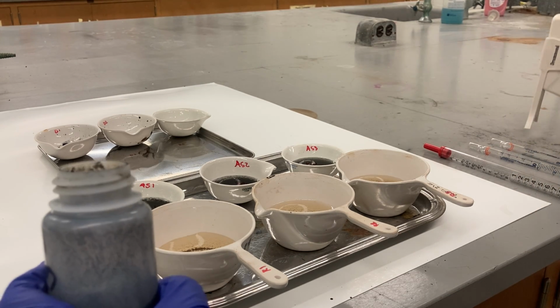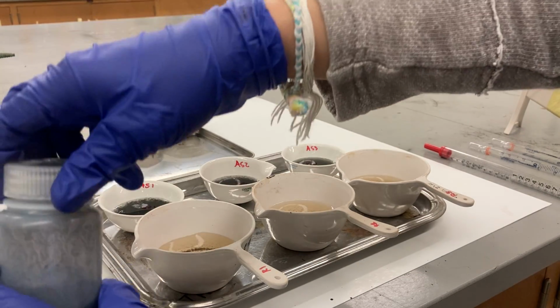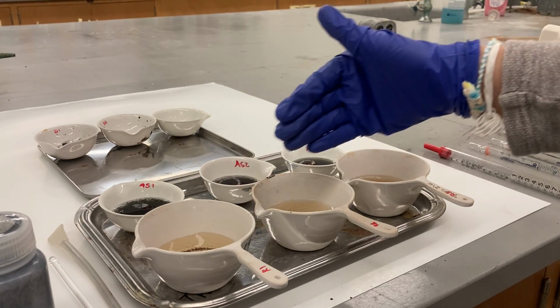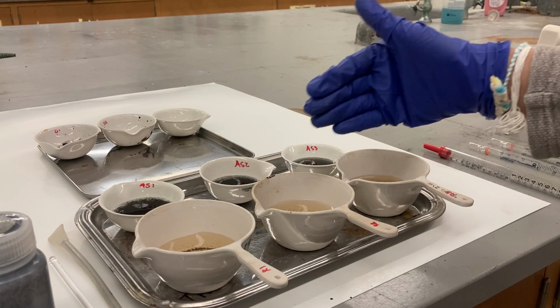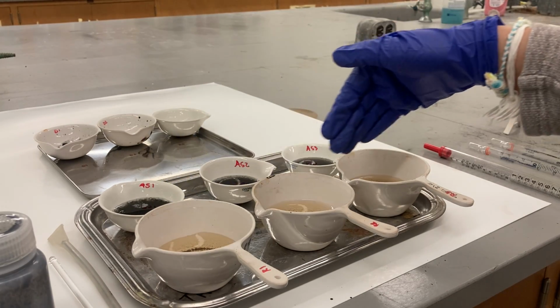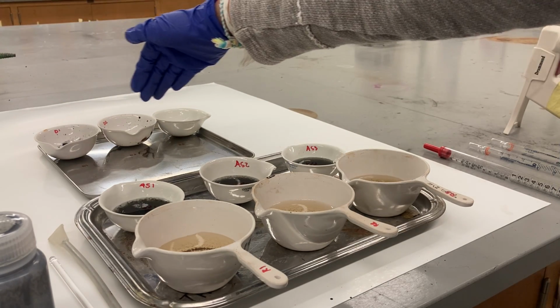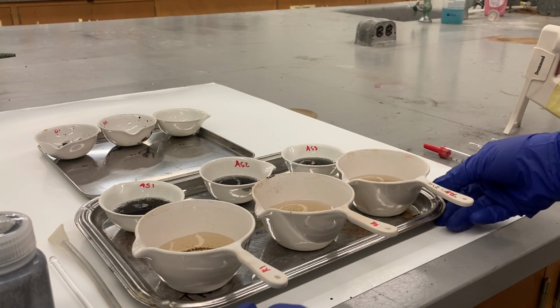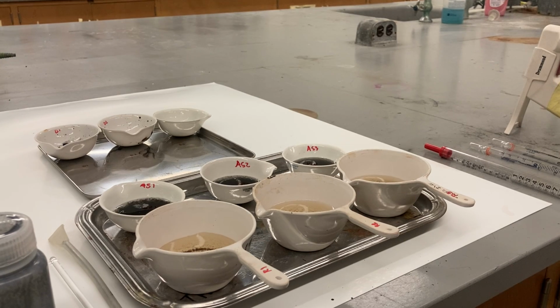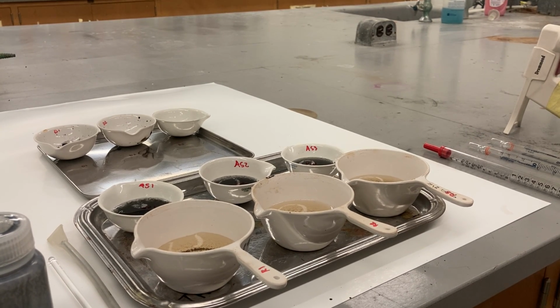Perfect. This is the third step of the total solids test. When we have less solid in our water sample, we have to use more volume, because in order for the scale to be able to detect the weight. This one has medium solid, medium volume. This one has a lot of solid, so use just a little bit of volume. Now I'm gonna take it to the oven, 103 to 105, at the end of the lab, in the back of the lab.